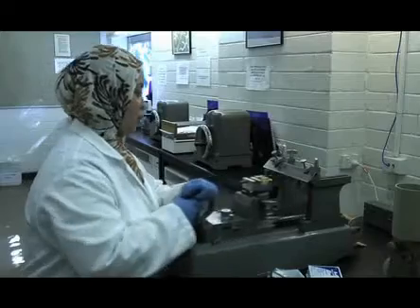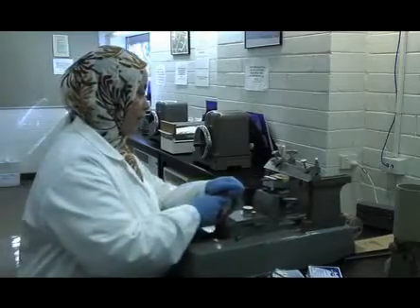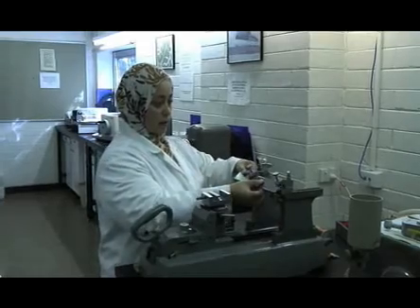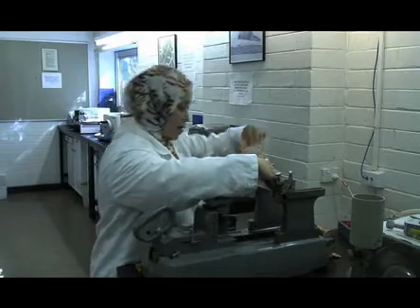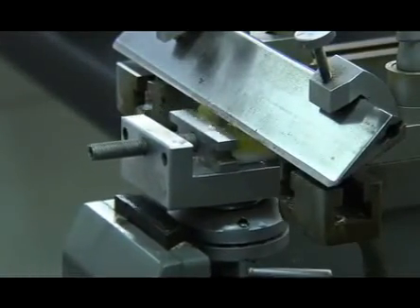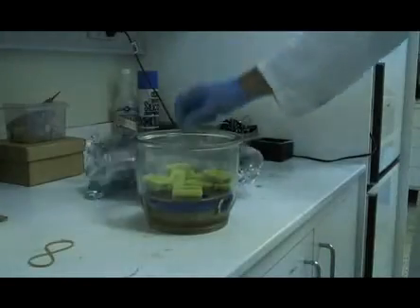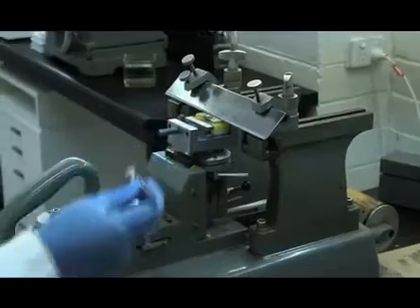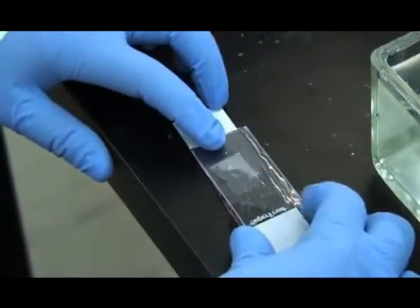The microtome provides thin sections which is best for light microscopy, and it is a technically challenging process. We suggest using a sledge microtome for the added strength it provides for cutting these hard blocks. A variety of blades can be used including tungsten carbide blades; however, we recommend a stainless steel blade as this can be resharpened easily and frequently as required. The blade should be orientated to make a 45 degree angle with the block. The methacrylate density is susceptible to many factors including the ambient humidity in the room, so the block should be stored in a desiccator. Surface softening can be achieved by applying a wet paper to the block if required. It may take several sections to achieve the right cutting conditions. The sandwich bag and additional slide are clamped to flatten the section before it is placed in the incubator.